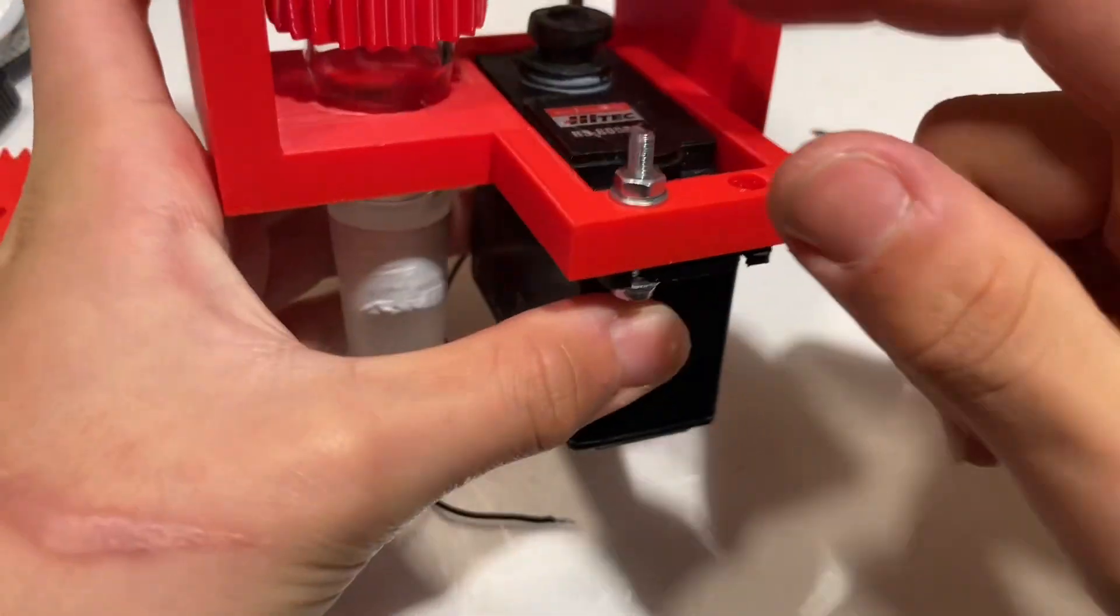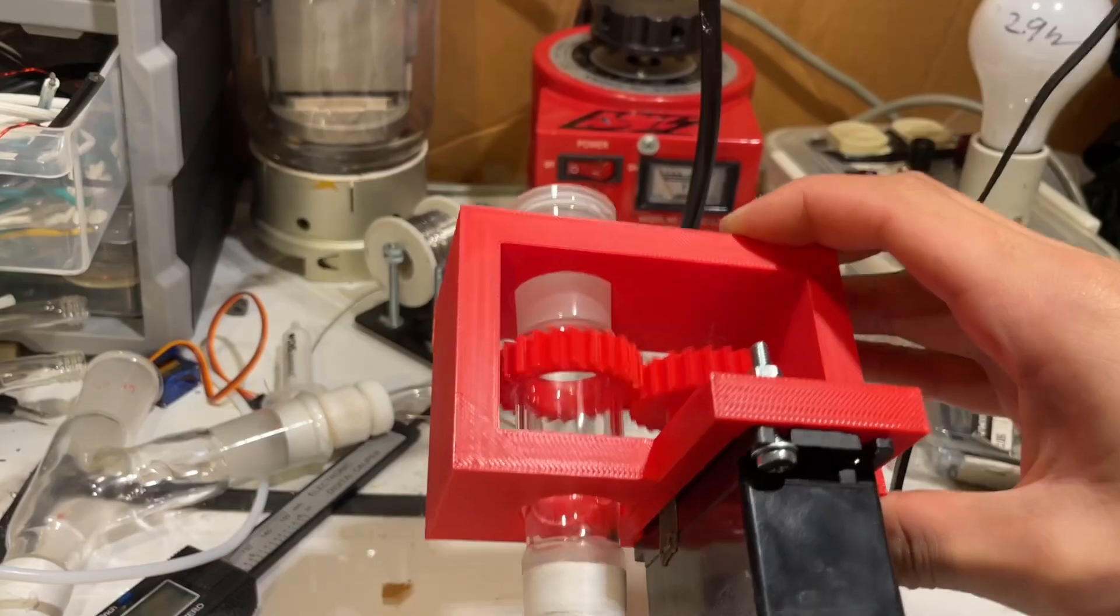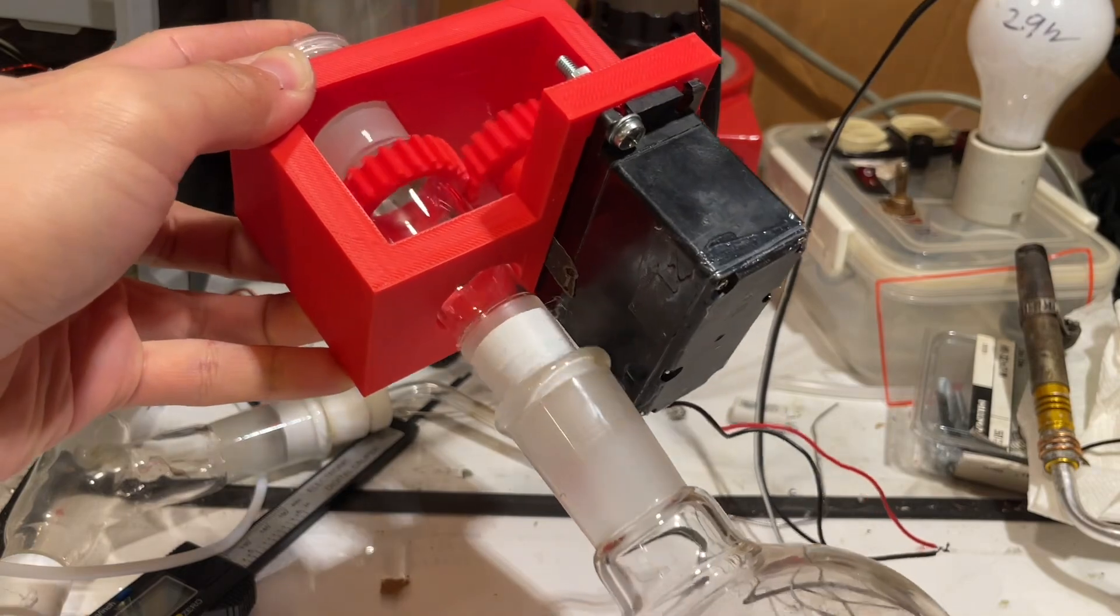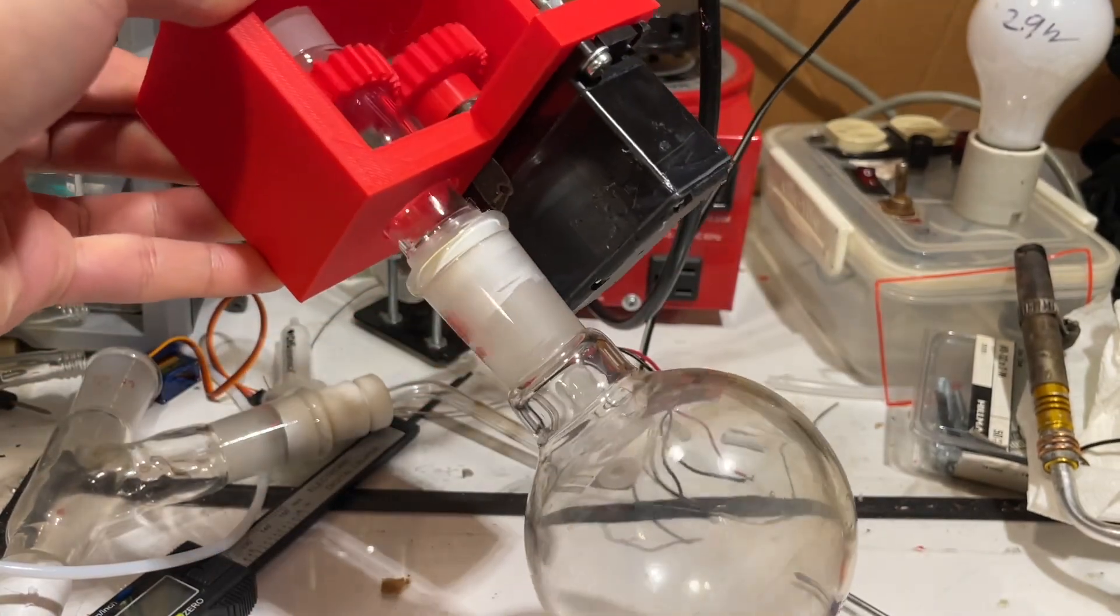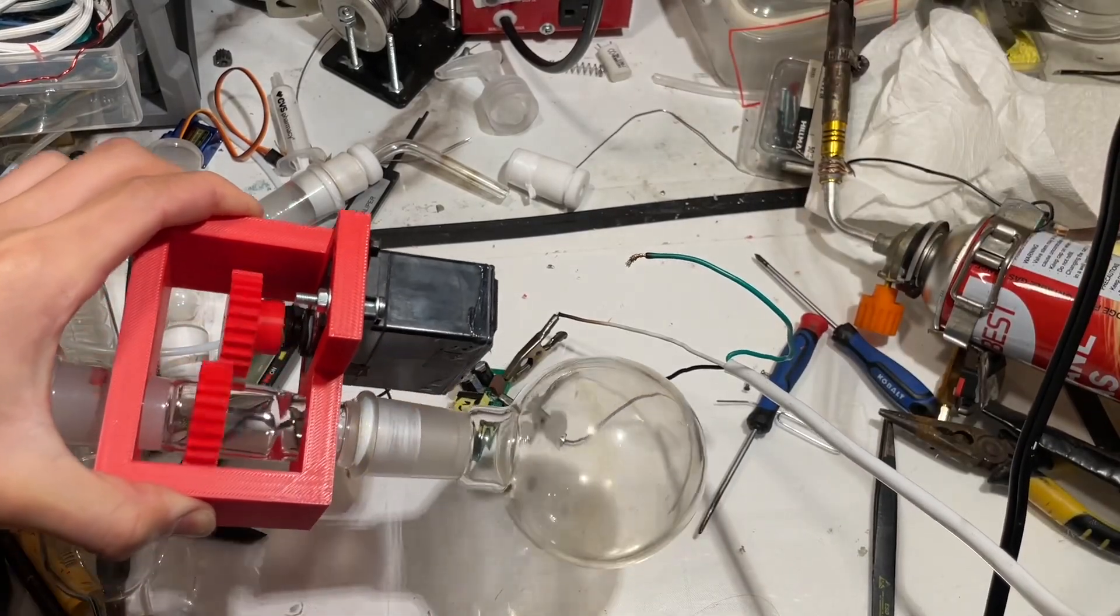No, the motor is hermetically sealed with a rubber gasket and is designed to be submerged underwater, so no vapors are getting in. You can see here it works, it's just badly designed.